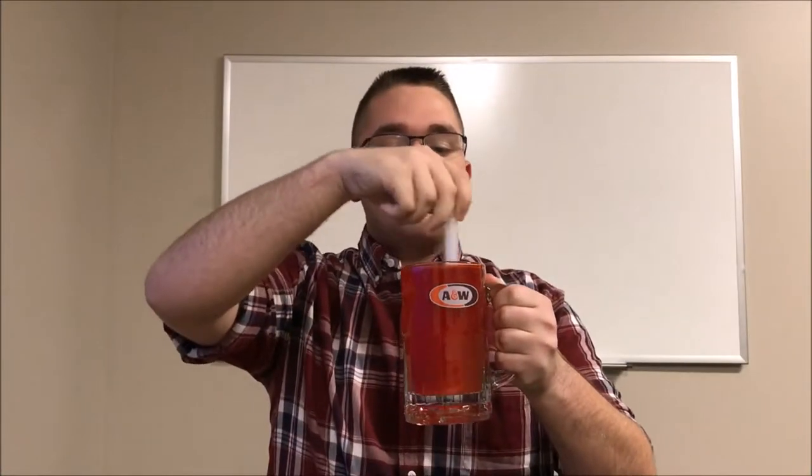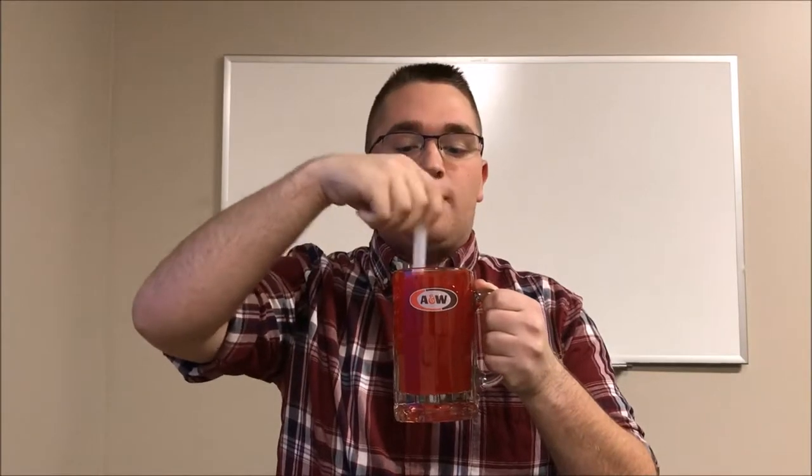Now I'm going to use my stirring rod to mix this up. So this is perfect. This is what we would call a 1X solution. We are not concentrating this in any way, shape or form. It's exactly as it was intended to be produced or exactly how it's supposed to look according to the directions.